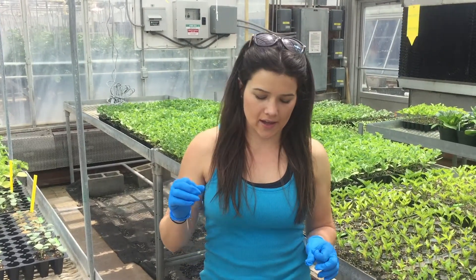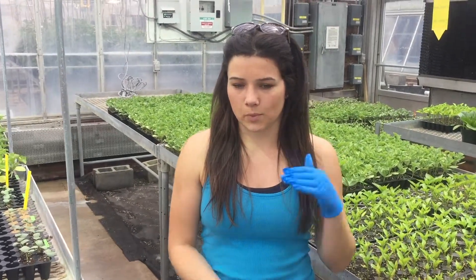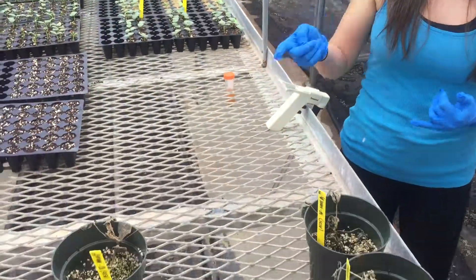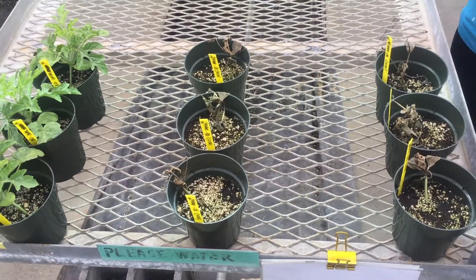We took the conidia from the inoculum and put that on a hemocytometer, counted how many conidia were in a concentrated area, then diluted that to get our spore solution. Using the spore solution, we inoculated seedlings of a universally susceptible host to Fusarium oxysporum forma specialis niveum — the variety is called Black Diamond. We inoculated with the spore solution, and as you'll see here, it was a high inoculum density, so the symptoms are very severe.